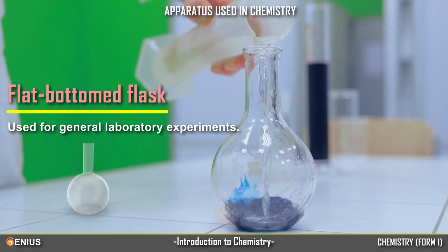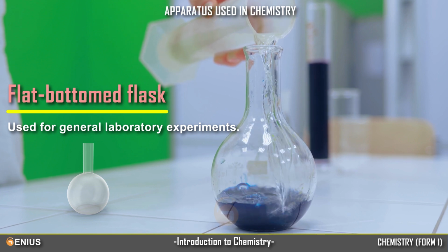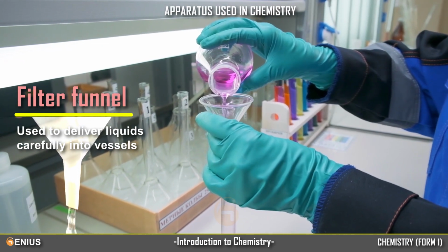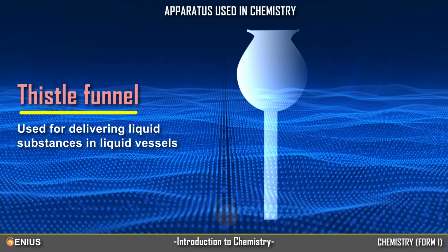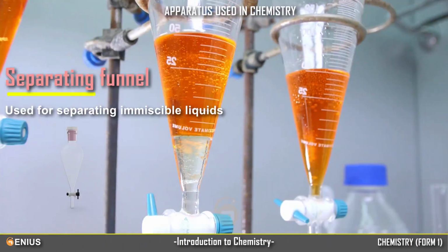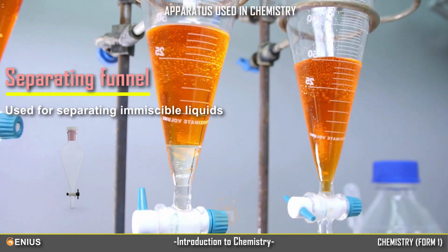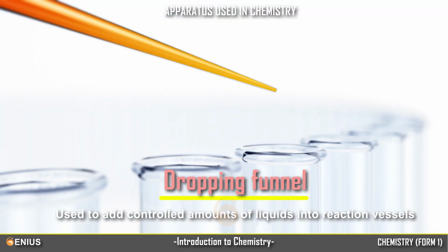Flat-bottomed flask, used for general laboratory experiments. Filter funnel, used to deliver liquids carefully into vessels. Thistle funnel, used for delivering liquid substances in liquid vessels. Separating funnel, used for separating immiscible liquids. Dropping funnel, used to add controlled amounts of liquids into reaction vessels.